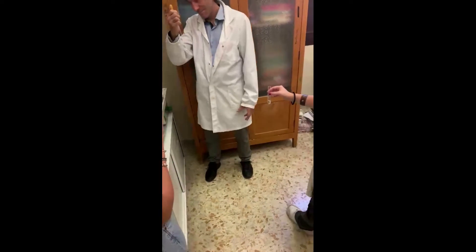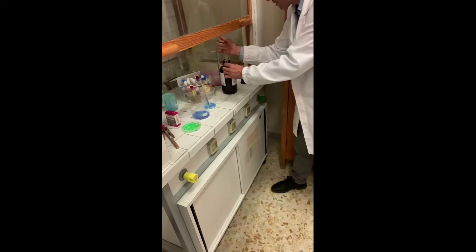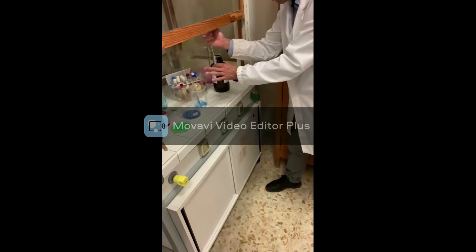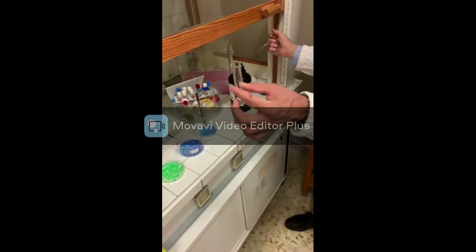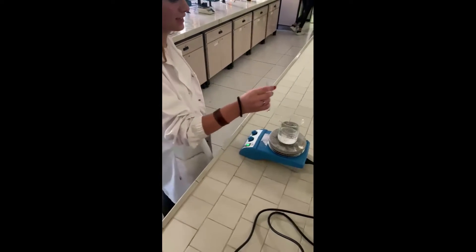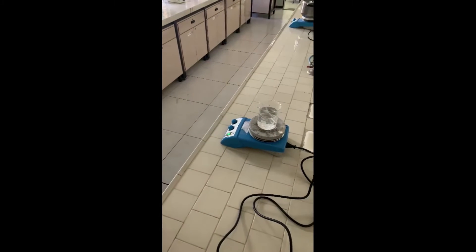The reaction needs concentrated sulfuric acid and heat to make it happen. Sulfuric acid must be handled by a trained adult.